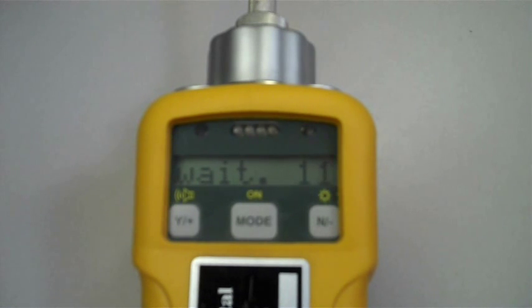The unit will now take readings and update its calibration memory. This will take approximately one minute. This is a good opportunity to make sure that your Tedlar bag is filled with 100 ppm isobutylene and ready for the next step.